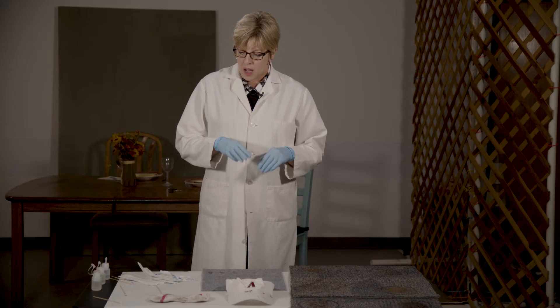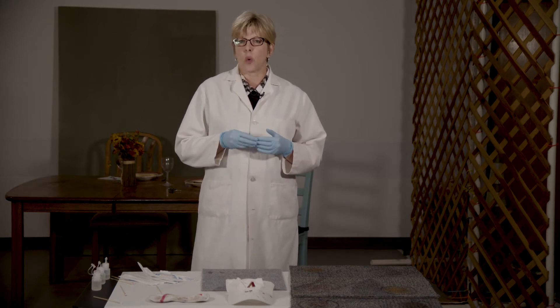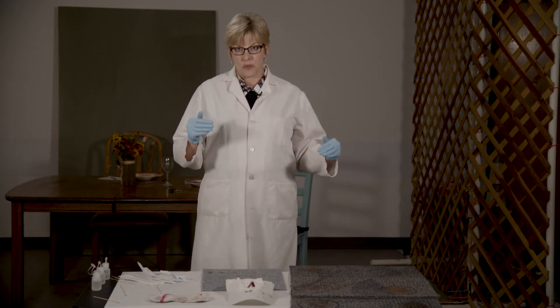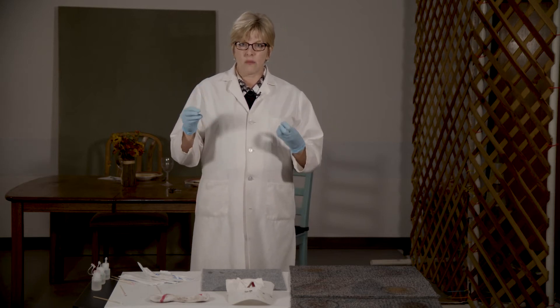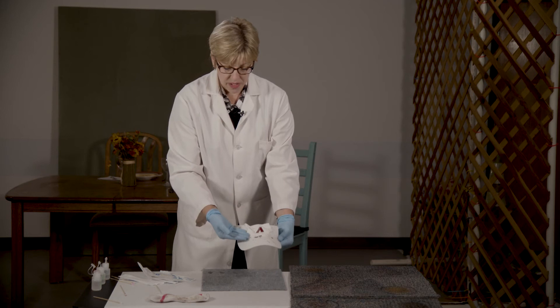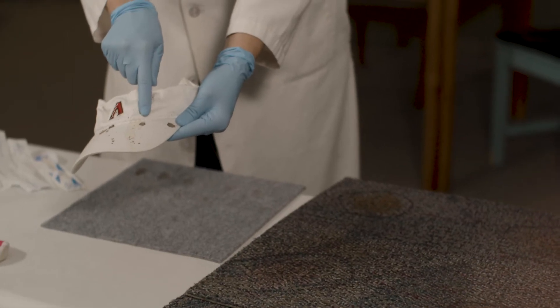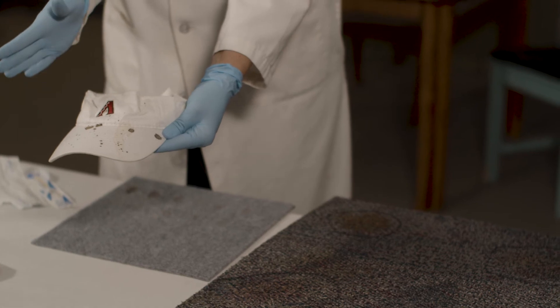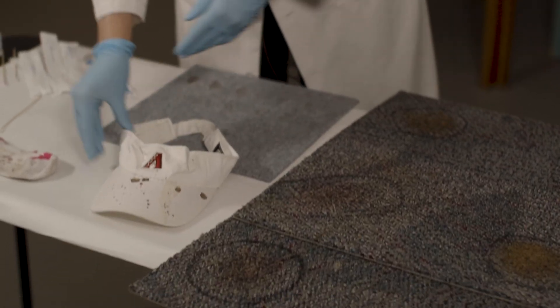Another thing to be aware of when developing your tests: blood can look very different on different surfaces. You typically think of blood as a bright red shiny substance, but on this white hat, the blood tested previously appears more brown and darker — it may not necessarily scream 'possible blood stain.'